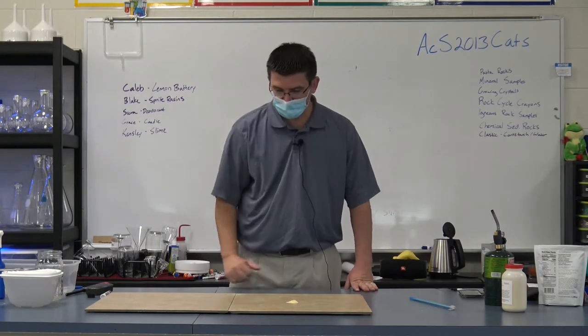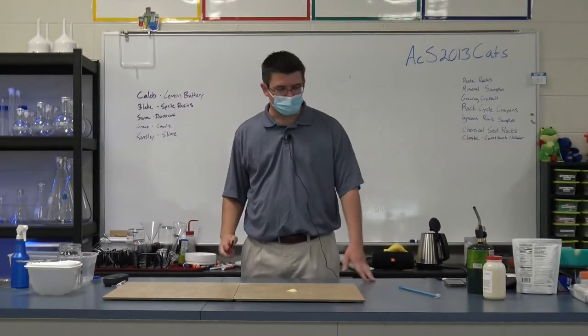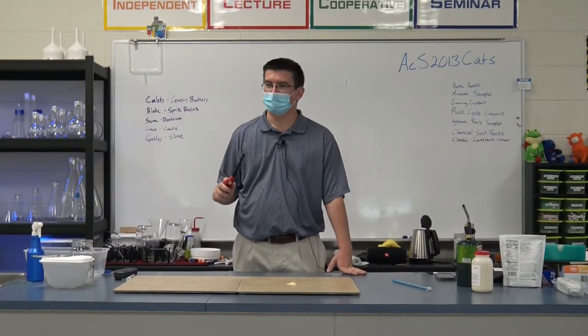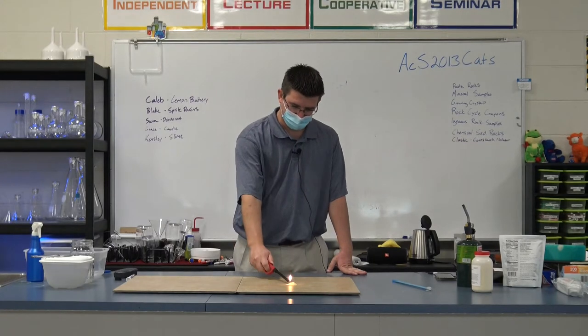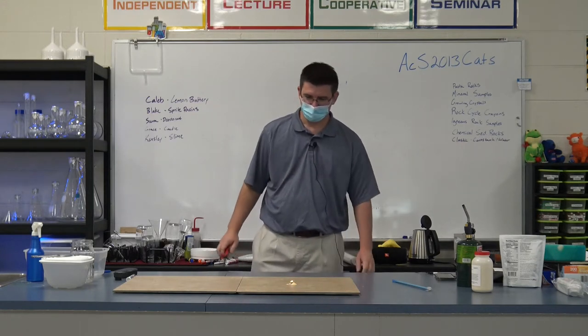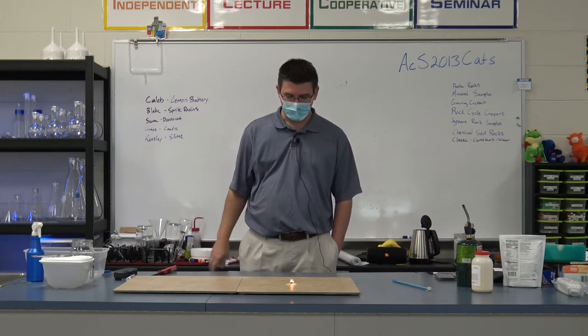So I'm going to take my Lycopodium here. I'm going to get a little pile of it. And again, it says danger, flammable solid. Is this going to explode when I light it? No, it's just going to catch on fire. Let's light it on fire here. It looks exactly like a candle. You're right. And it's burning about like a candle would.